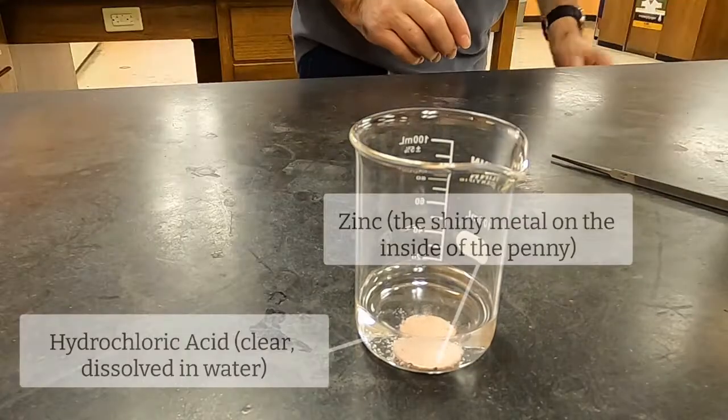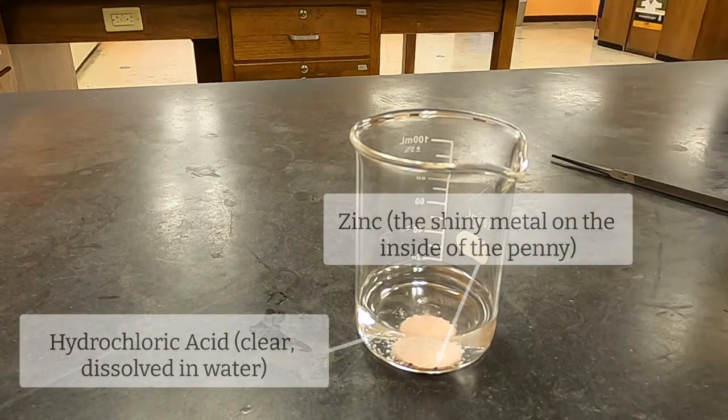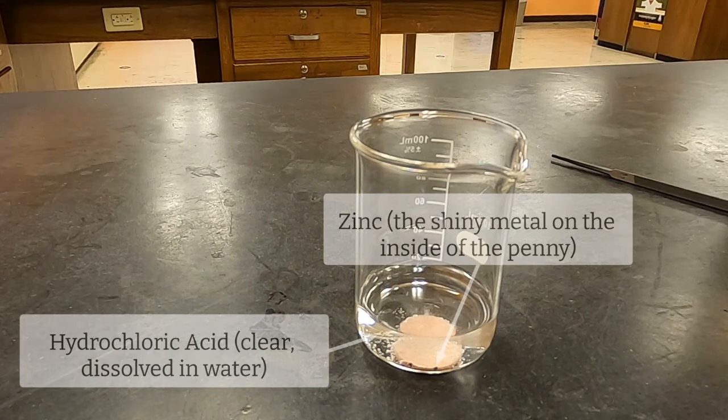And then you're going to put that into the hydrochloric acid. The bubbles that are being produced are hydrogen gas, though we're not producing enough of it to ignite it, to test it. And then the other product, the zinc chloride, is staying dissolved in the water.